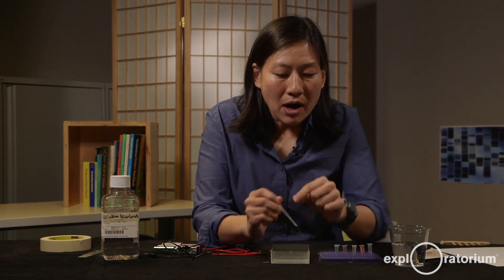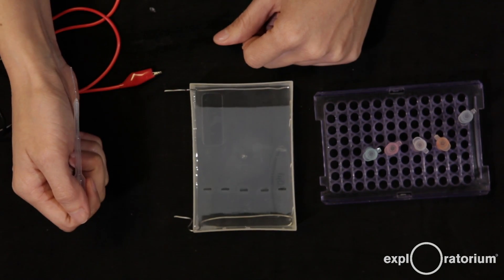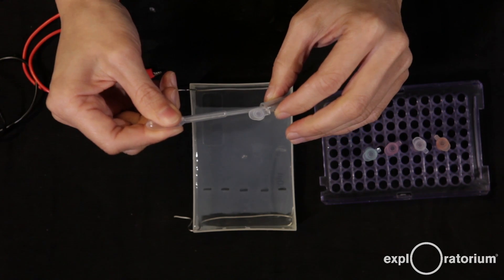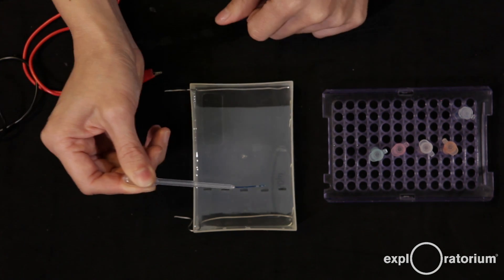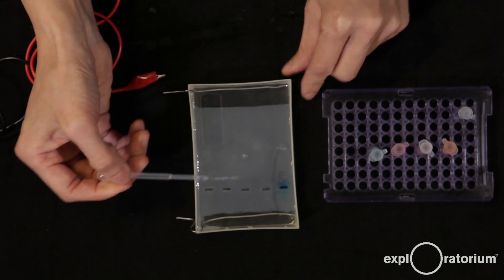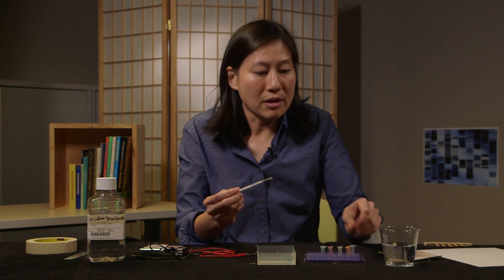When loading, be careful not to jab a hole into the gel with the tip of the pipette. Once your sample is loaded, hover just above the well and squeeze it in — because it's denser than the buffer, it falls nicely into the gel. I like to load with a dark background because it's much easier to see the wells. This takes a little practice, but you can practice as much as you want. Here I go — I hover right over my well and squeeze it in. Most of it fell nicely into the well. Rinse the pipette between samples.